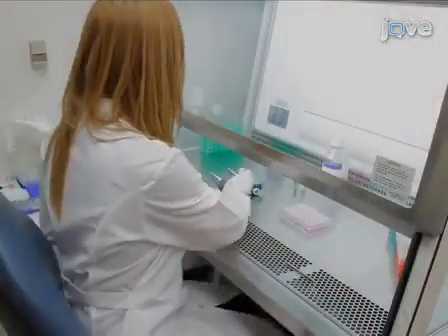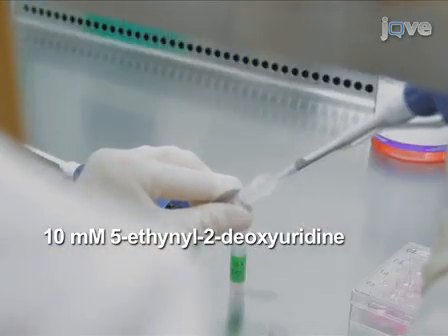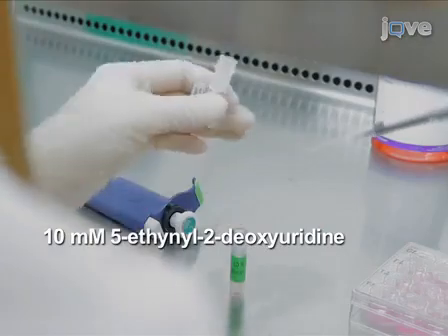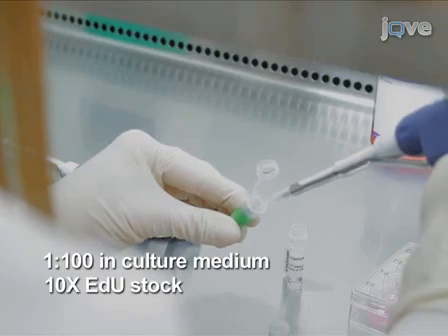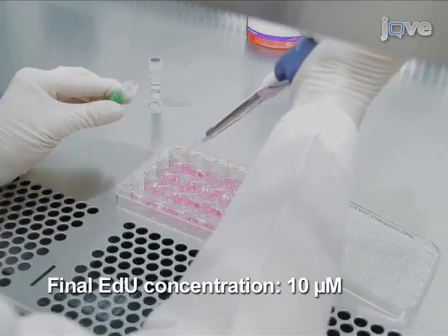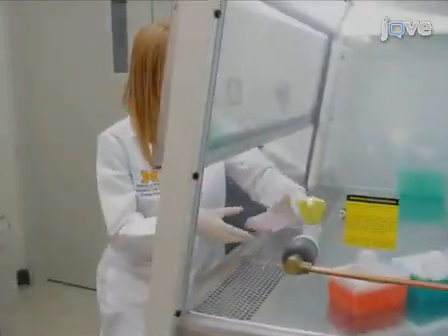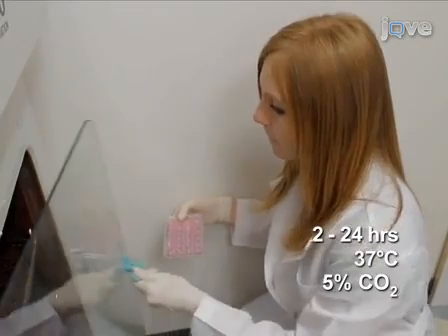Dilute the 10 millimolar stock of 5-ethynyl-2'-deoxyuridine, abbreviated EDU, from the Click-iT EDU microplate assay kit 1:100 in culture medium for a 10x EDU stock. The 10x EDU stock is then added directly into the medium in each well. Incubate the treated neurons for 2 to 24 hours at 37 degrees Celsius and 5% carbon dioxide.